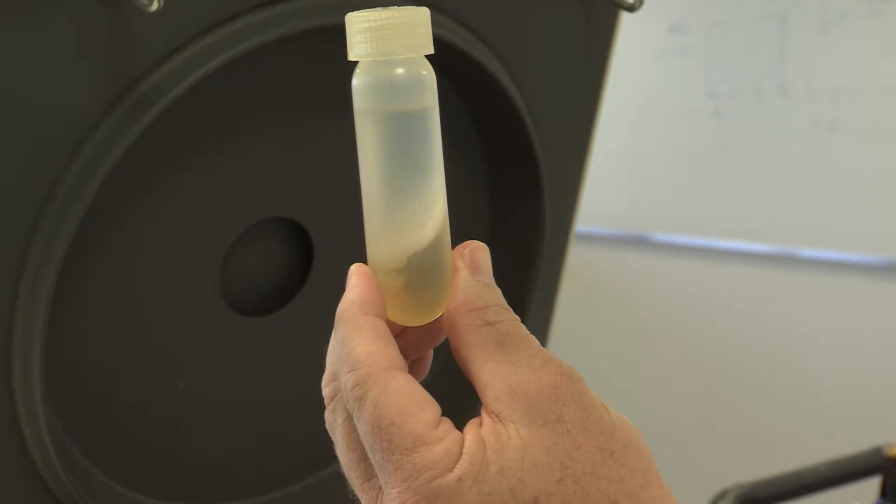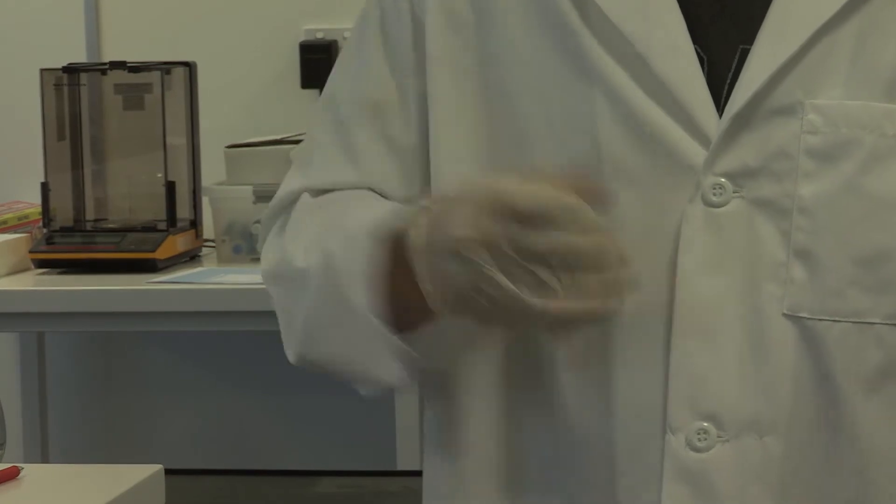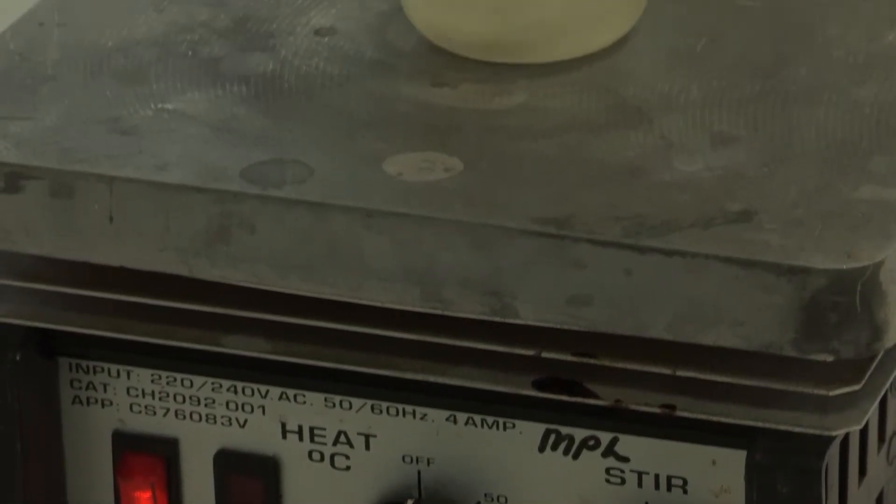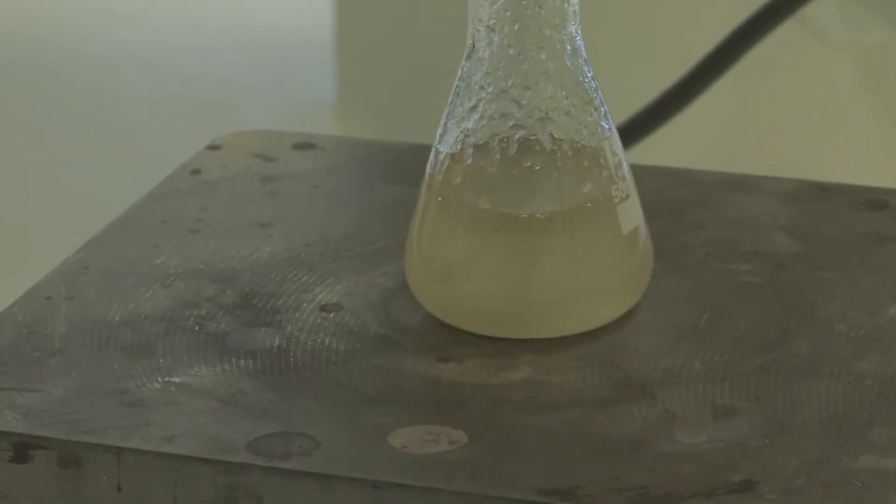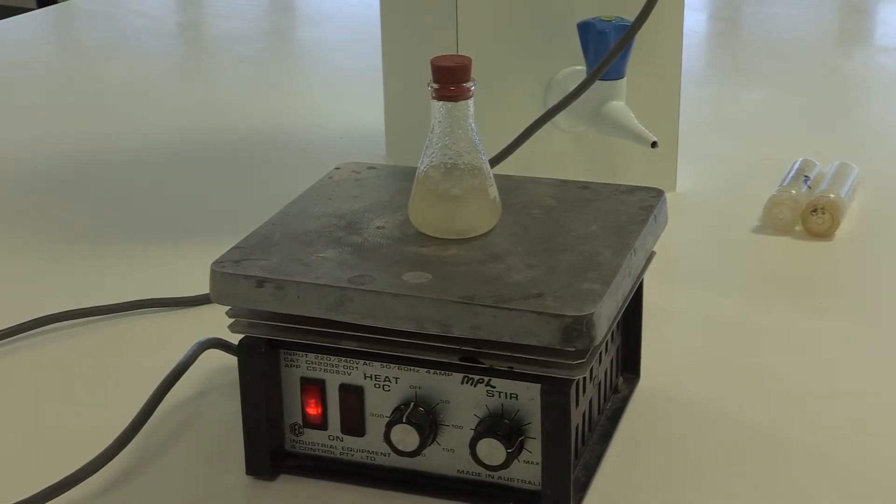It's very important to get really good mixing to ensure complete extraction. This mixing can either be done by hand, but it's hard work and tedious. You can buy wrist shakers which will do a lot of it for you, although we found vigorous mixing in a small flask works just as well.